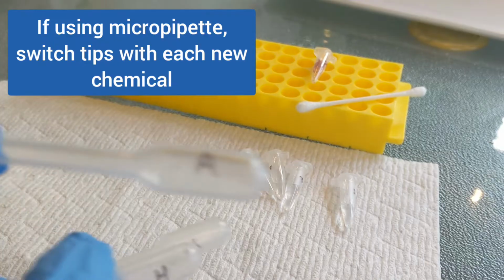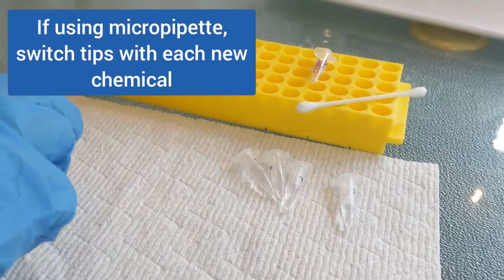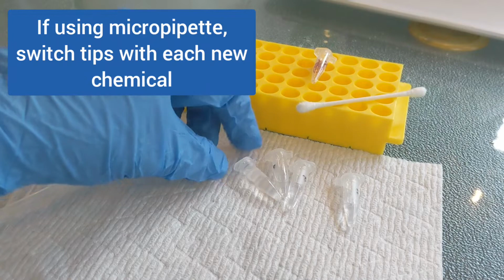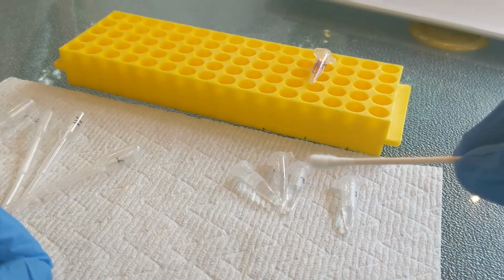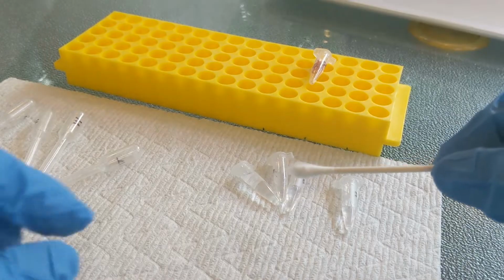So the alcohol pipette with the alcohol tube.